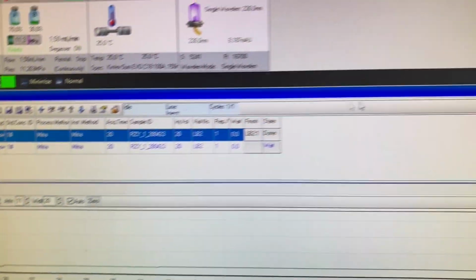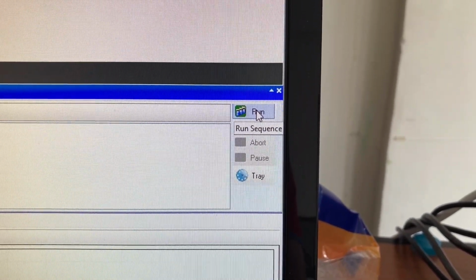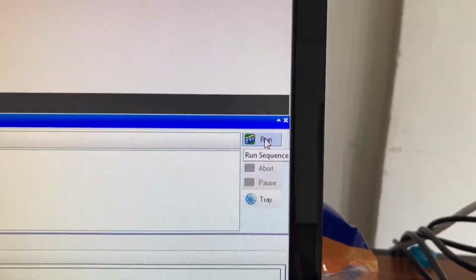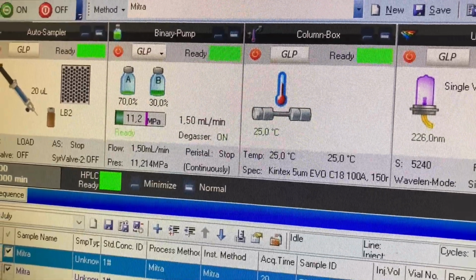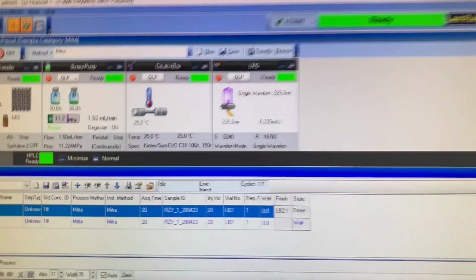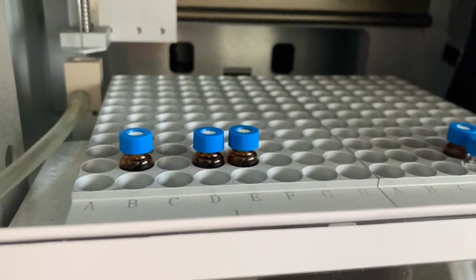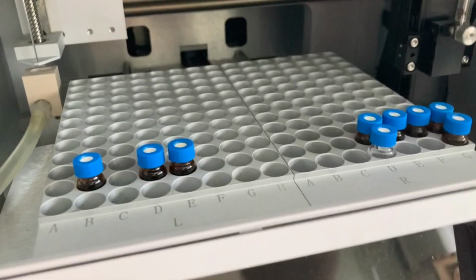So what I'm going to do is a run, which you click on that one there, and then the pressure will increase and we'll see if it blows it out or not. It's just like a trial run. I've got an old sample in the vial, just an old vial there, should still read something, and we'll see what happens.